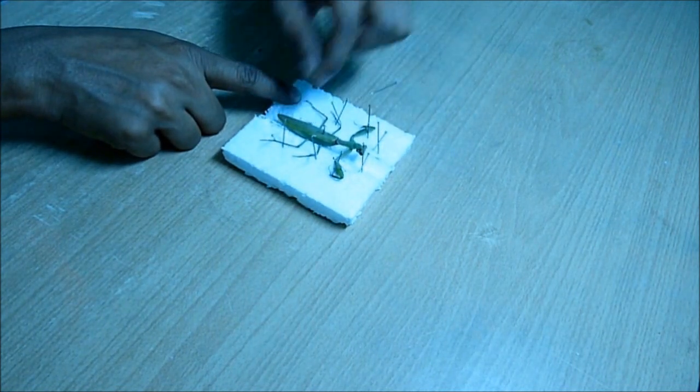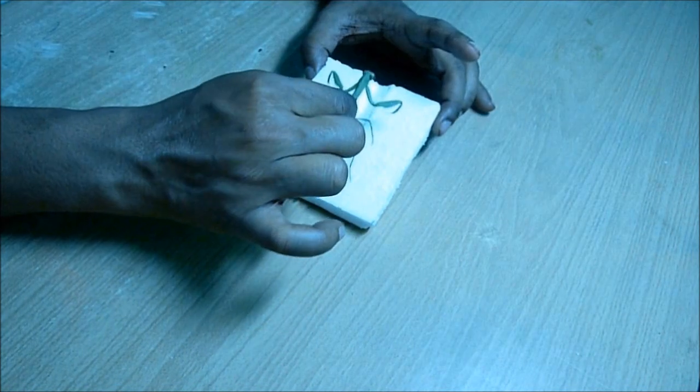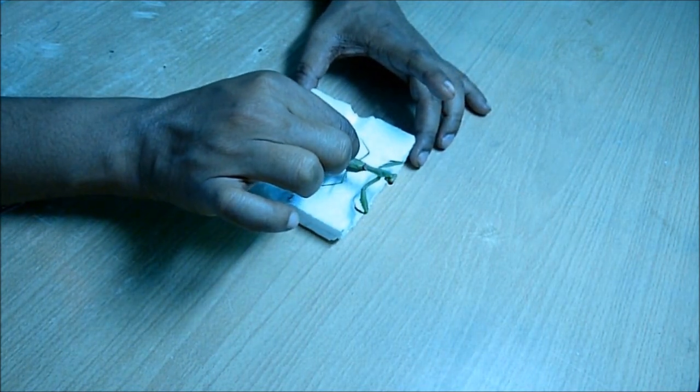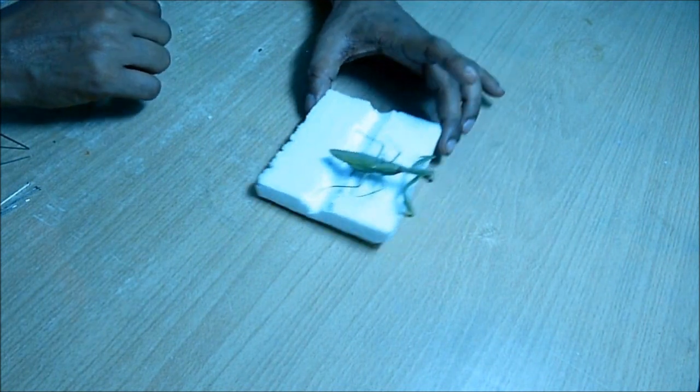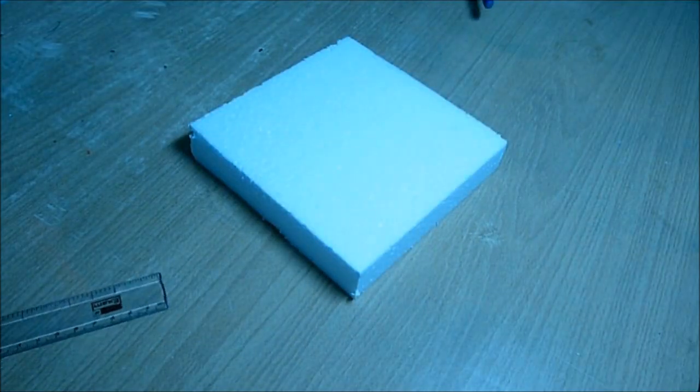Then I gradually and slowly removed all the pins. And then I held the center pin only which I didn't remove. You can see the insect is fully dried.